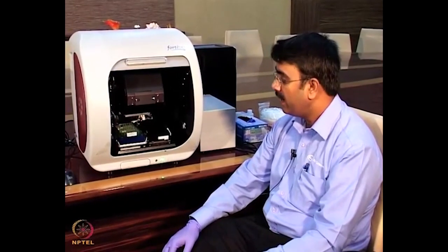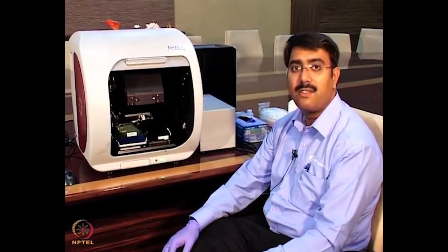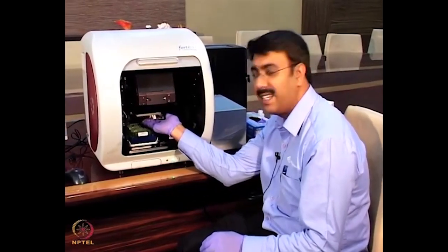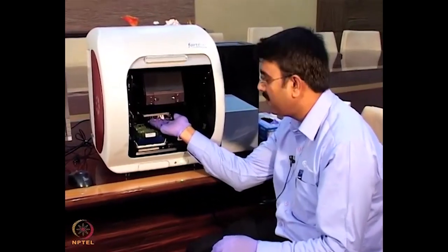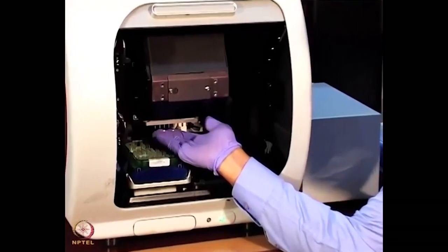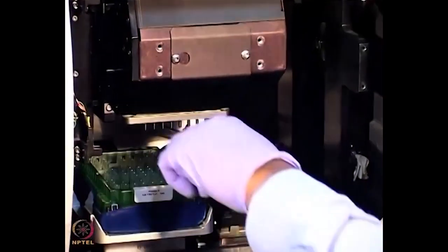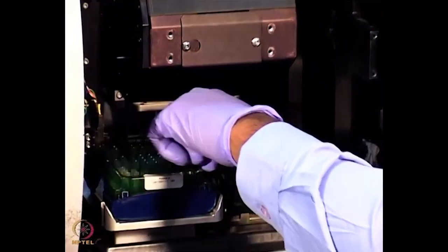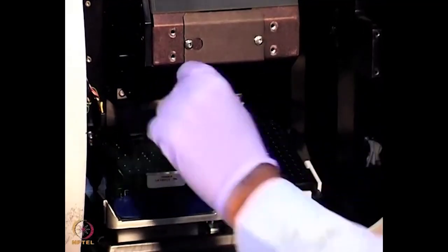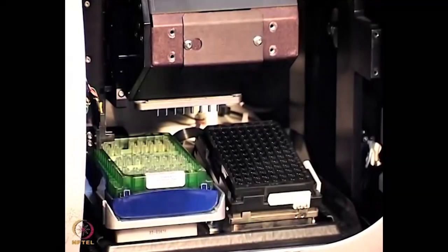You know about the principle behind bio layer interferometry from the last talk. Here it consists of a white light — this is called white light, emitted by a light emitting diode. We are passing the light through the sensor. If you look at this, this is the sensor.